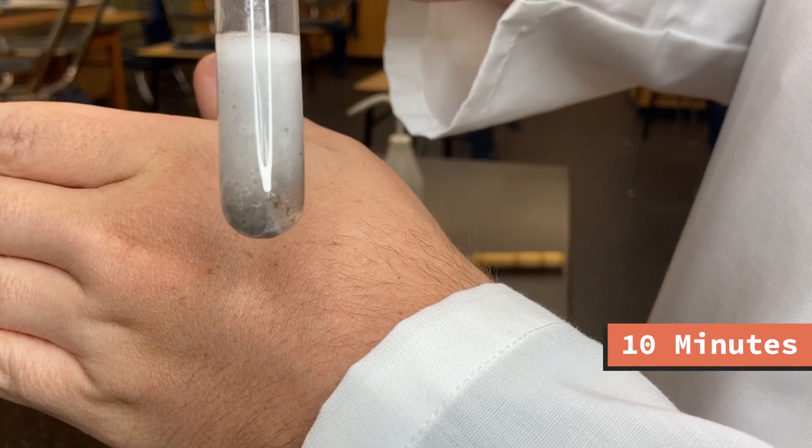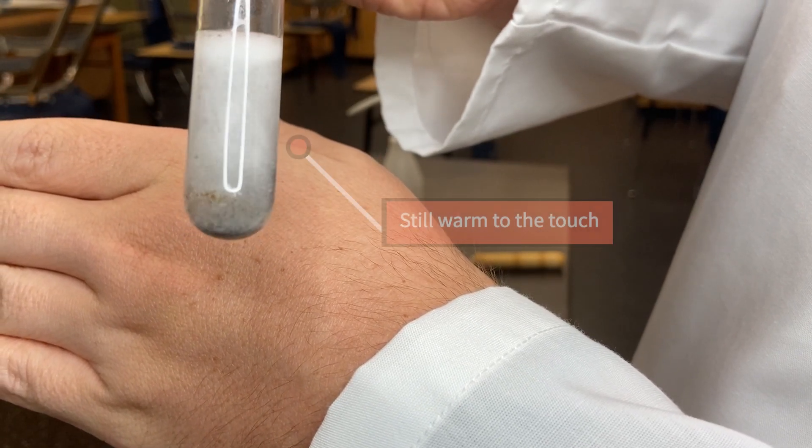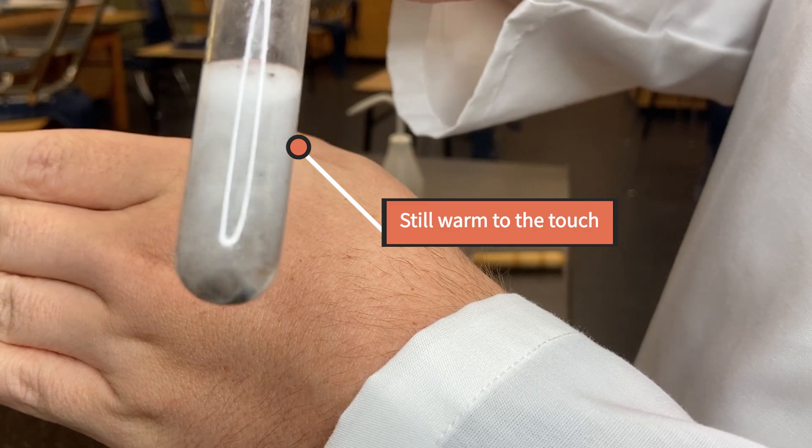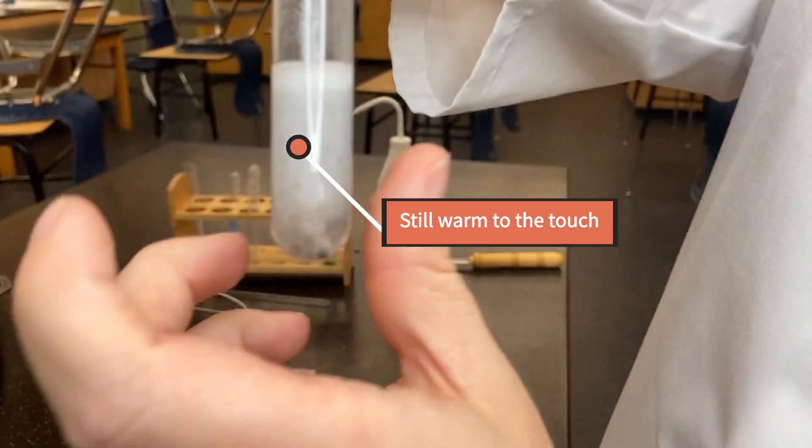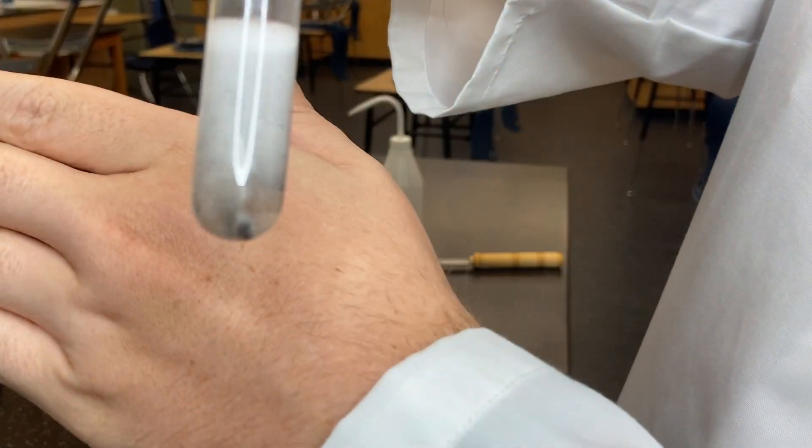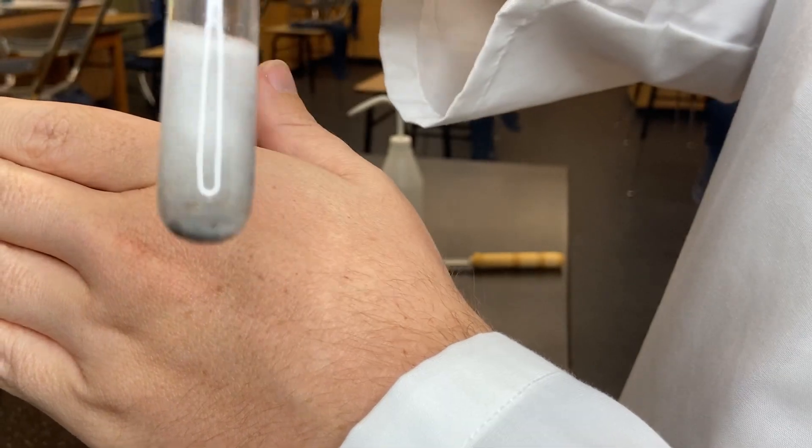It's about 10 minutes later. We can see it's still going, still warm to the touch. But notice the difference in the zinc here, its appearance.